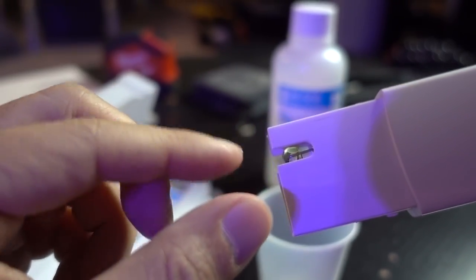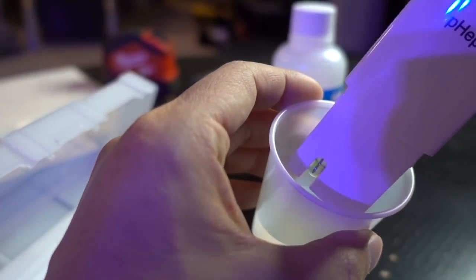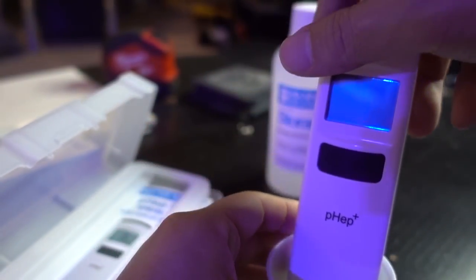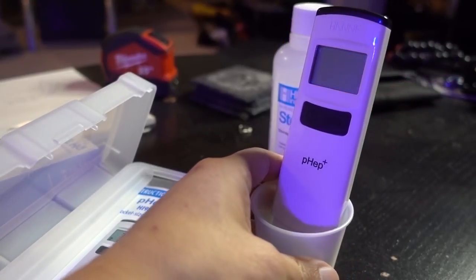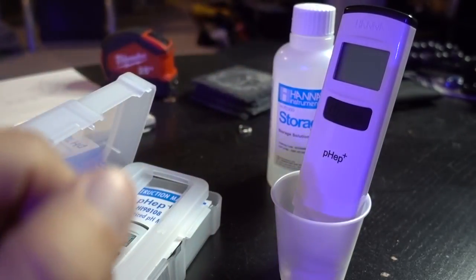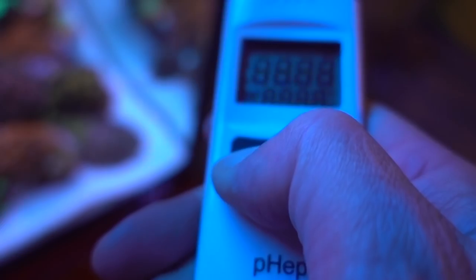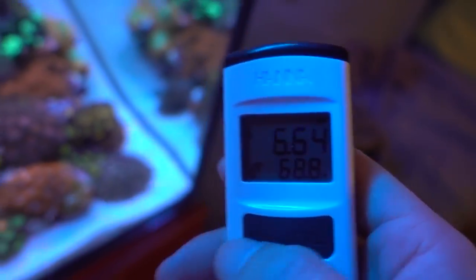You do not want to be rough with that. You don't want to scratch it up. It has some coating on it. Definitely don't want to touch it with tissue and stuff like that. They do have a cleaning solution if you need to clean it, so don't use paper towel. But for now, because I haven't used it in a while, I'm just going to let it sit in this storage solution for about half an hour while I do all the tests and we'll come back to this.